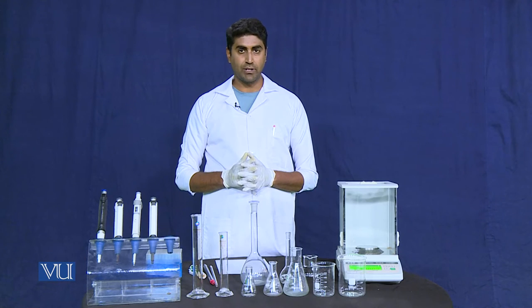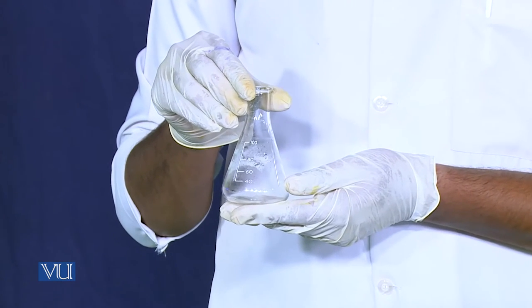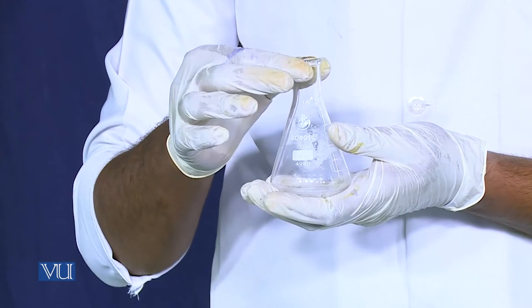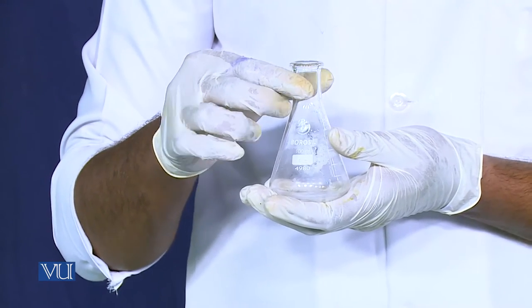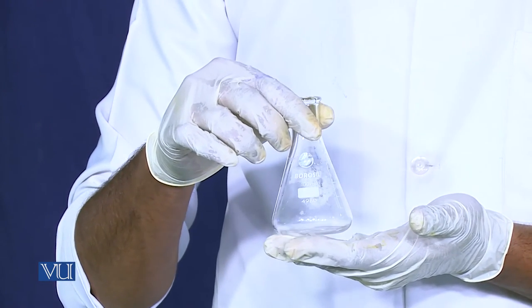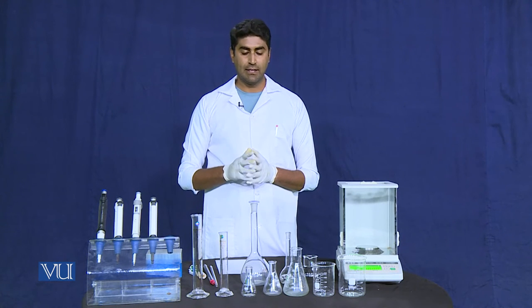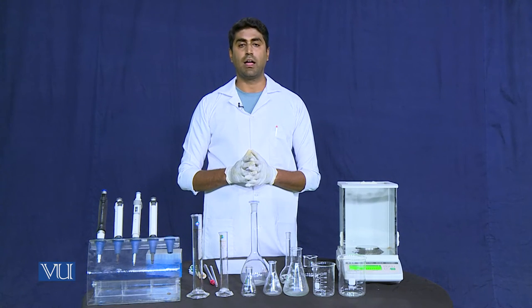The next glassware we have is the conical flask, also known as the Erlenmeyer flask. It has a flat bottom and narrow neck. It can be used for transferring of the solution and gently shaking of the solution when you need to mix it. It also comes in various volume capacities. When we need a solution to be covered, we can cover its mouth with paraffin film and cotton.